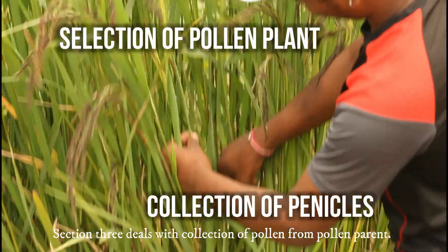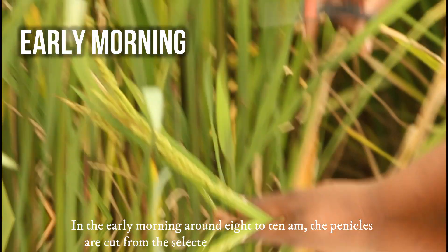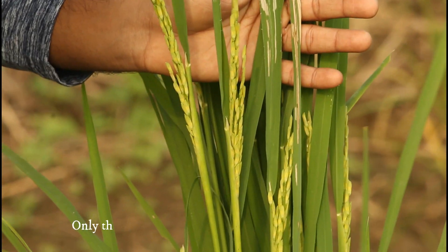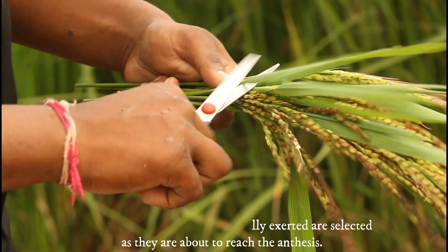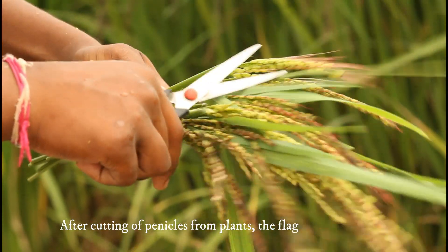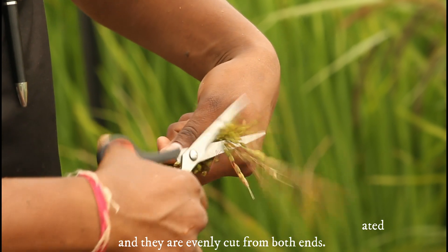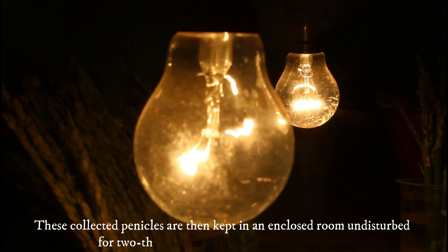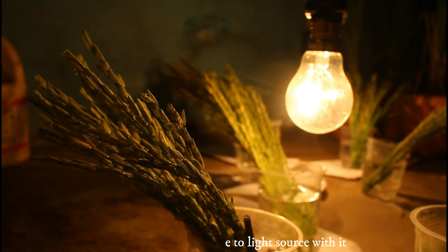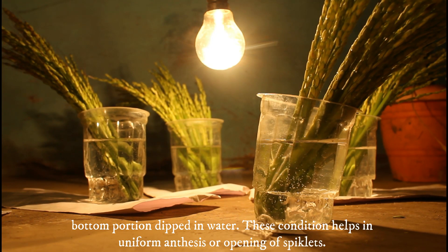Day 2, Section 3 deals with collection of pollen from the pollen parent. In the early morning, around 8 to 10 am, the panicles are cut from the selected plants of the pollen parent. Only panicles which are partially exerted are selected, as they are about to reach anthesis. After cutting, the flag leaf is separated and the panicles are evenly cut from both ends. These collected panicles are then kept in an enclosed room undisturbed for 2 to 3 hours, close to a light source with the bottom portion dipped in water.